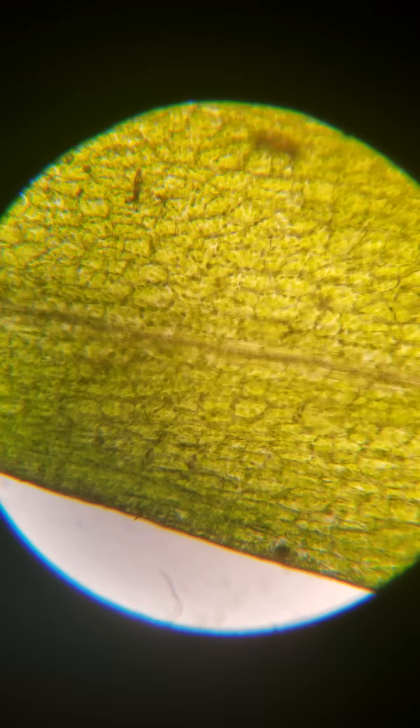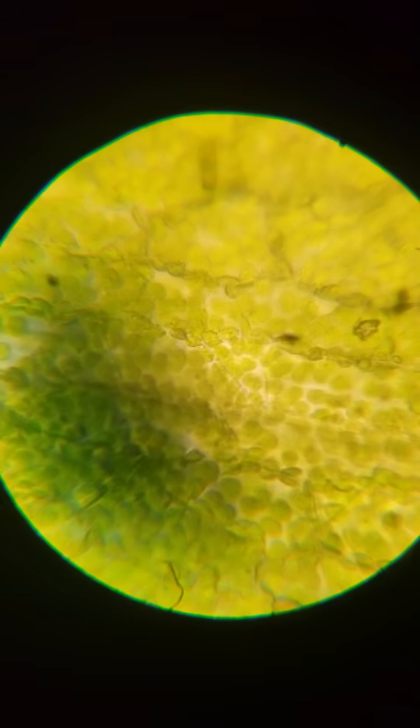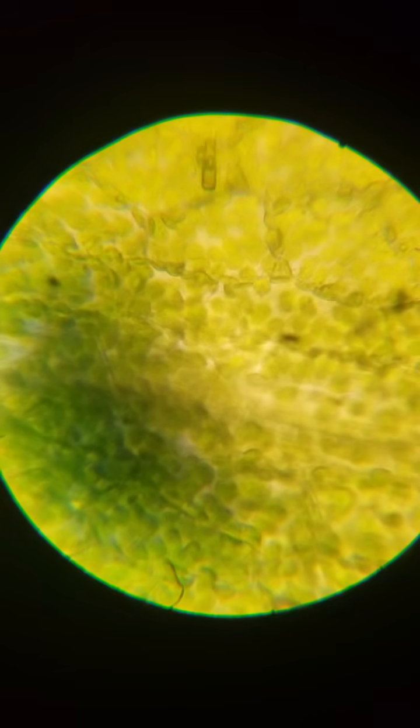You can see that they have thick cell walls with chloroplasts, little clumps of it. If we zoom in all the way to 400 times zoom, best I can do, you can actually see the little sacs of green chlorophyll in the plant. It's hard because everything's a 3D object underneath the microscope, but that is what it looks like.